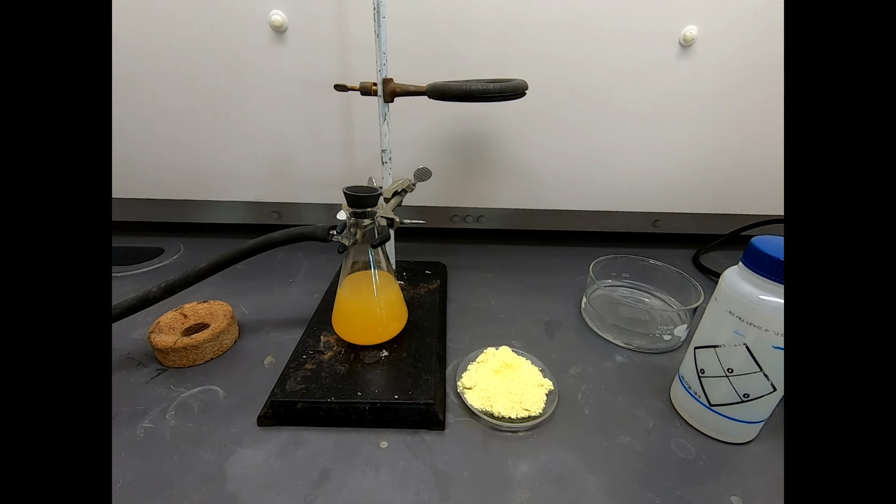But of course, maybe I didn't, and maybe that's what I was smelling. Hopefully it wasn't a lot. The NMR will certainly tell us that, and maybe the TLC, and maybe a little bit in the melting point. But now we're off to characterization of this isolated crude product.